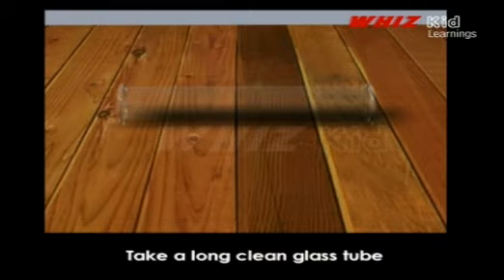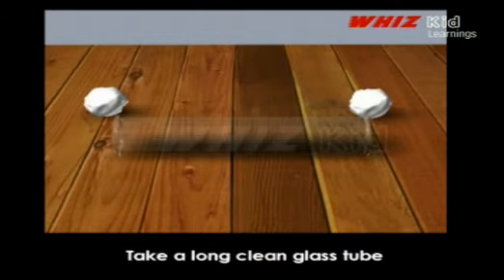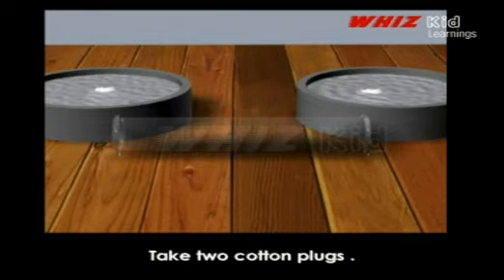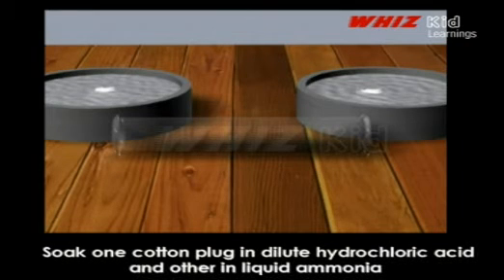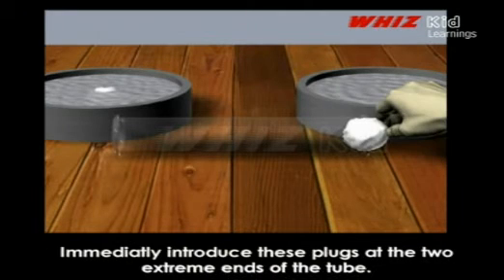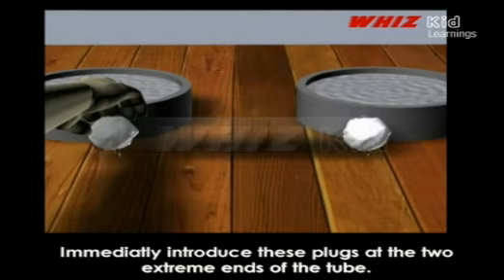Take a long clean glass tube. Take two cotton plugs. Soak one cotton plug in dilute hydrochloric acid and the other in liquid ammonia. Immediately introduce these plugs at the two extreme ends of the tube.